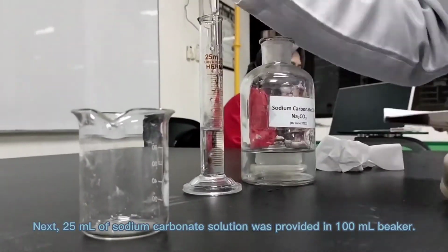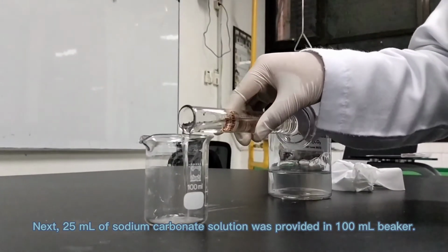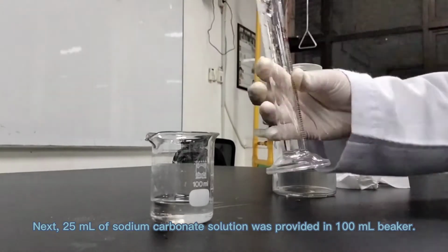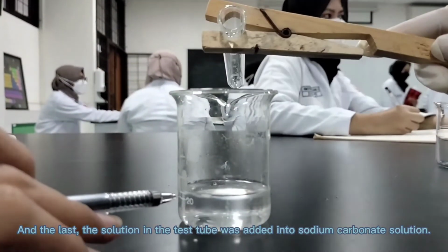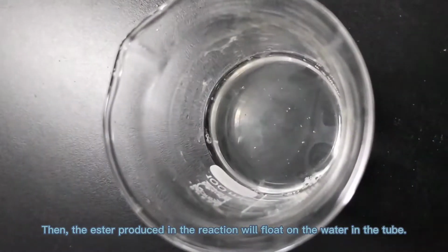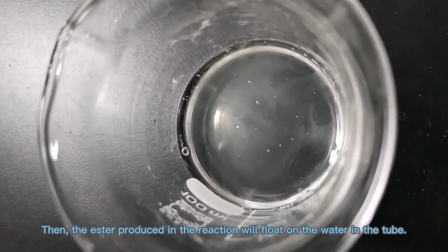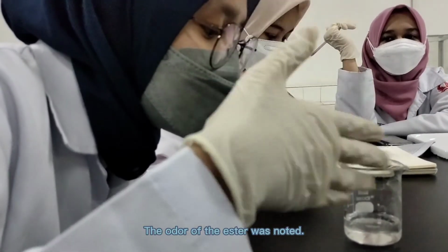Next, 25 ml of sodium carbonate solution was provided in a 100 ml beaker. And the last, the solution in the test tube was added into the sodium carbonate solution. Then the ester produced in the reaction will float on the water in the tube. The odor of the ester was noted.